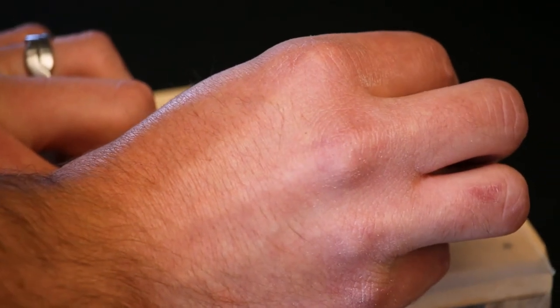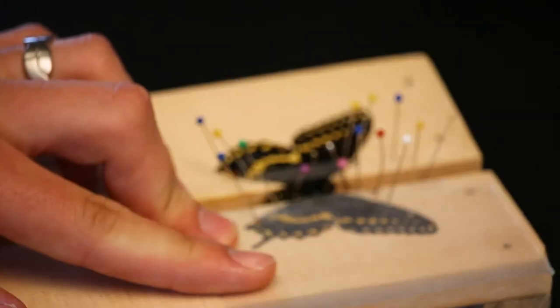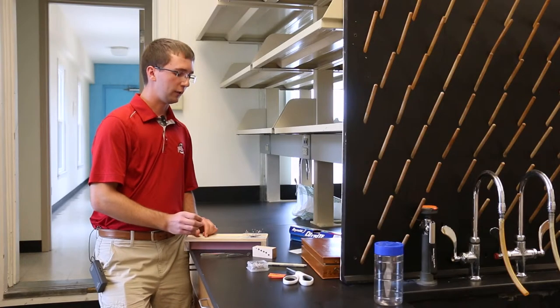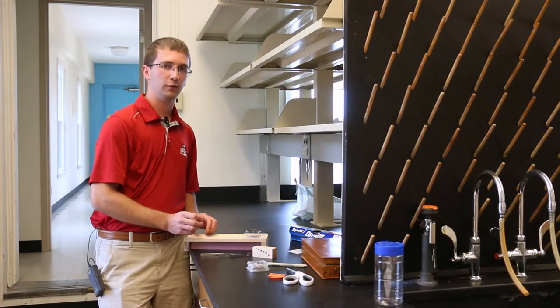So now that I have both of the pieces of wax paper down on the wings, I'm going to add my label that I made to keep the correct information associated with the specimen.